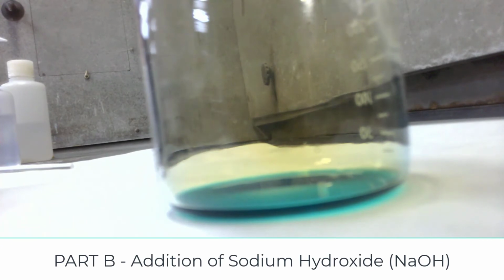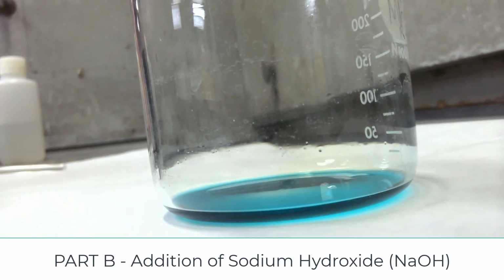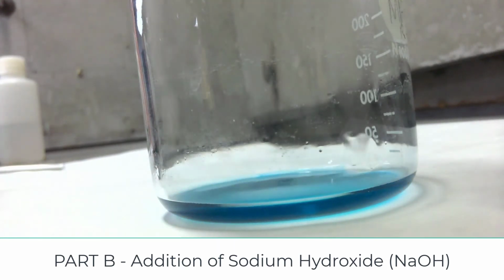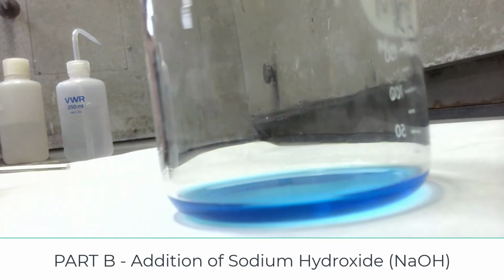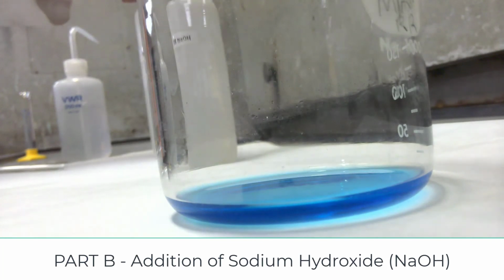I used just a little over half a gram of copper as recommended. And notice it still takes quite a while for the reaction. Okay, it appears to be done. Now I'm going to add about 10 milliliters of water. Then I'm going to add 8 molar sodium hydroxide.